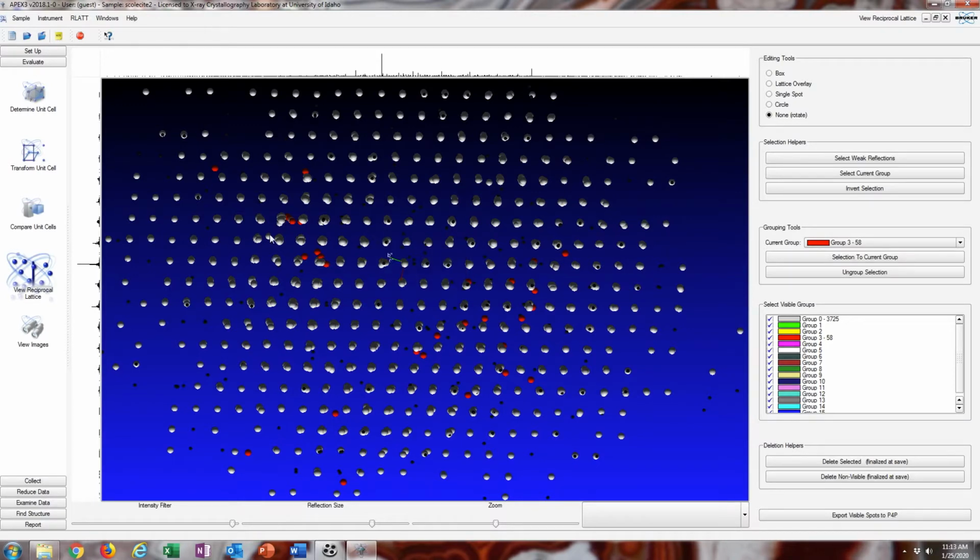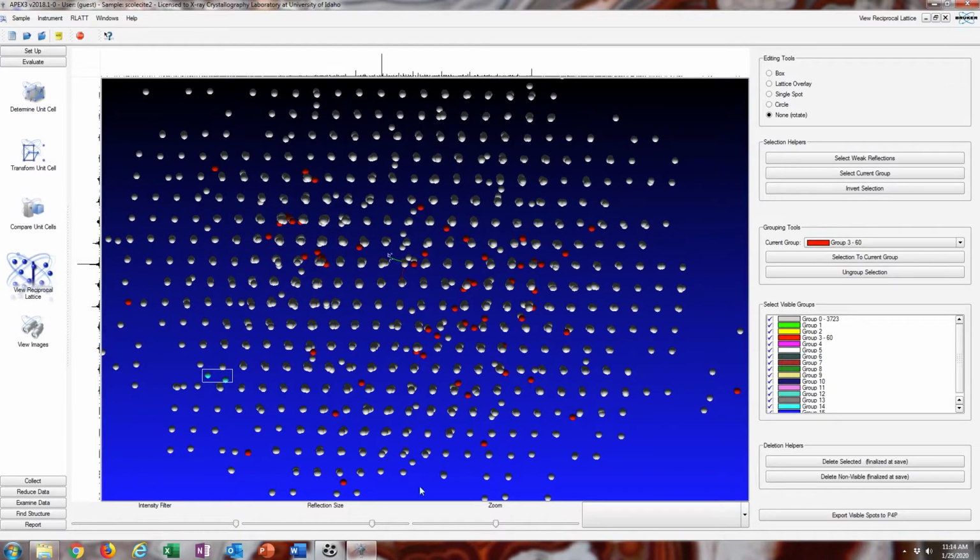I decided to just go ahead and hand pick some of these bad reflections, or these reflections that don't correspond to the main lattice, that stick out to me. But this is totally optional. In this case it's very easy to see what is a part of the main lattice and what is apparently not. These two reflections, for example, definitely not. And then I just move them to one of the groups. In this case it's just the red group, and then I do all of my data reduction and everything on the gray group. As I said, the best application for this is for twinned crystals. It's probably the best way of dealing with twinned crystals, honestly. And anytime you have multiple crystals in the same scan.